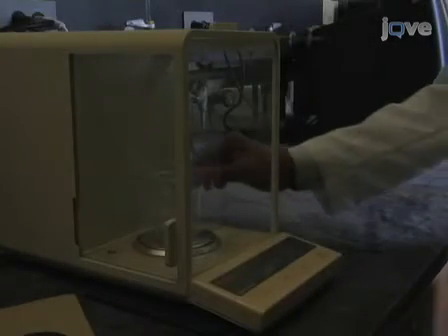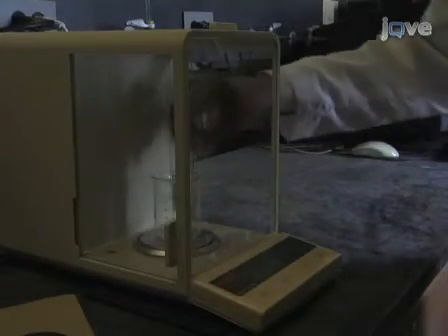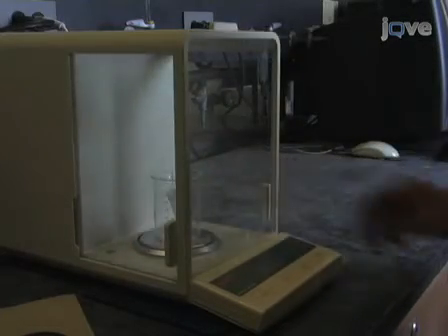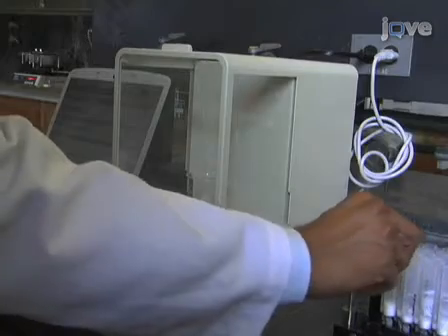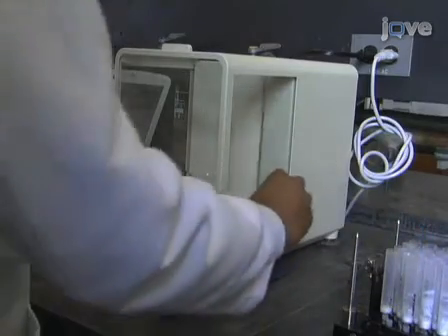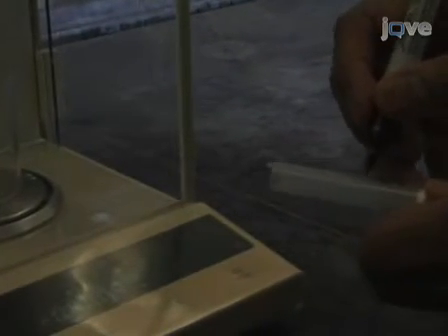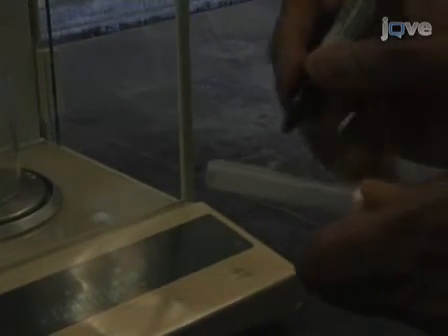After the tubes are dry, they are weighed again and the amount of precipitate is determined by subtracting the empty weight. Unfortunately, there is enough variability in the tubes that each one must be weighed empty. A sample from each solvent system is analyzed by NMR to ensure that all products are pure.